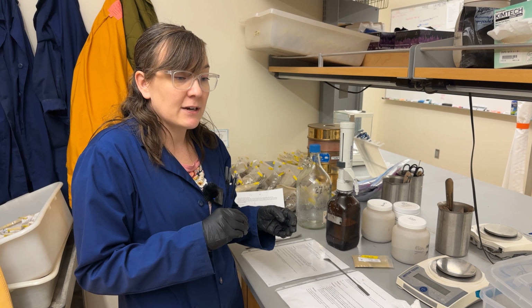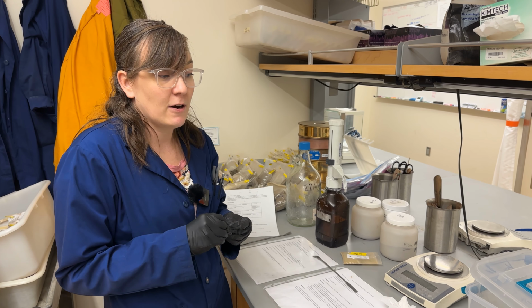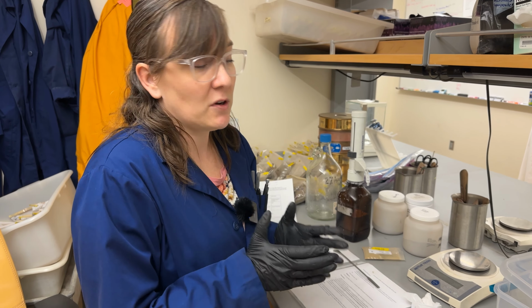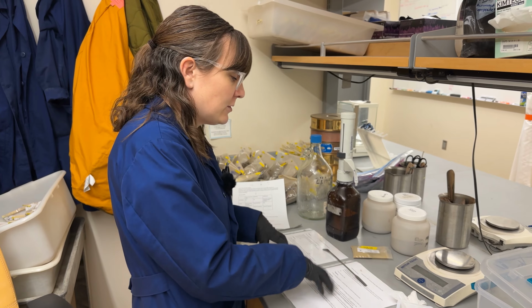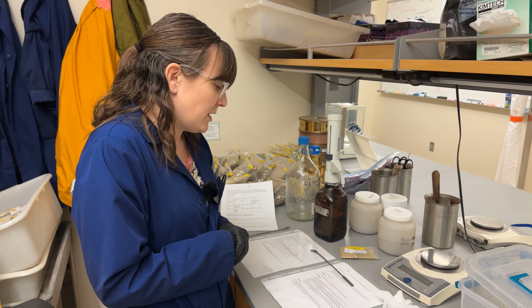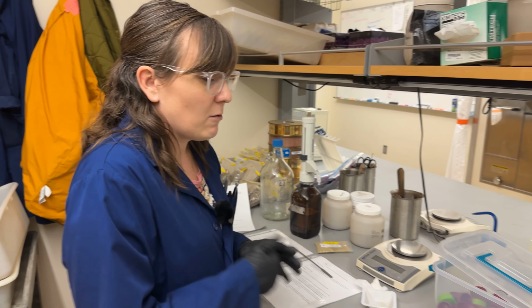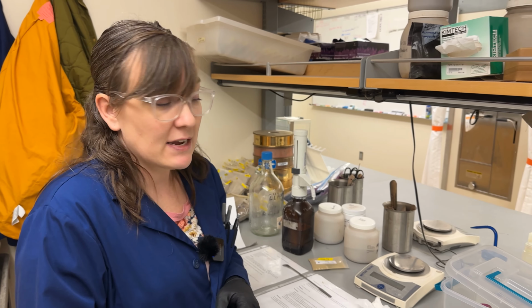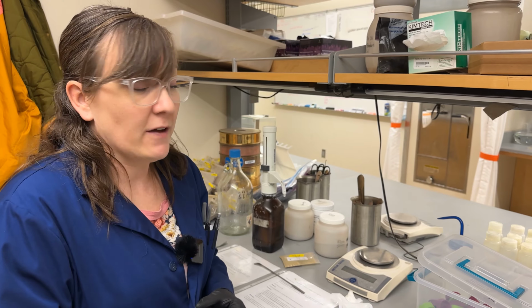It should release all of it, so it should be done pretty quick. There are some extractions for soils that are the plant available nutrients, so those are a little bit more time sensitive. But we'll follow the recommended procedure here. So once those are all weighed out, make sure you do a blank and a duplicate in your KCl. We're ready to go put it on the shaker.